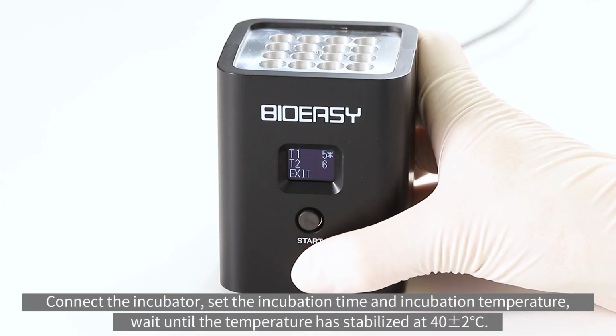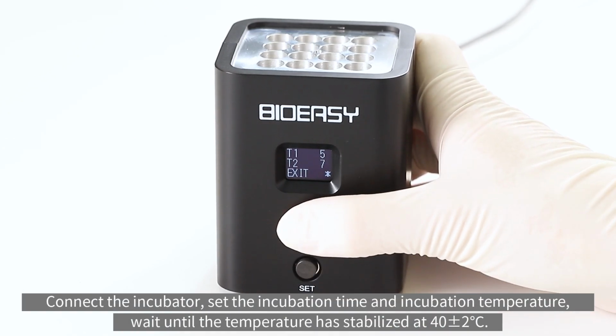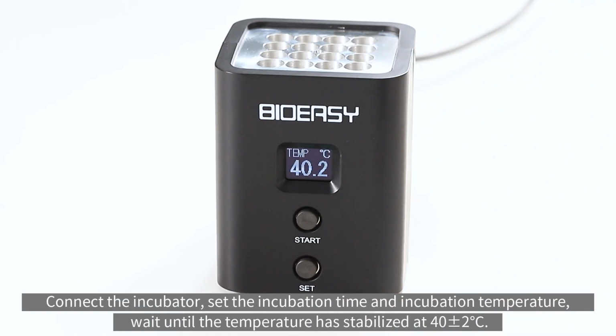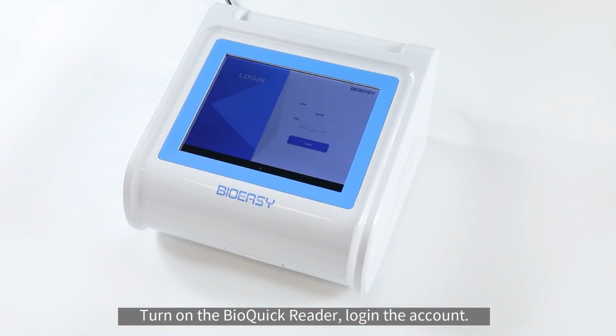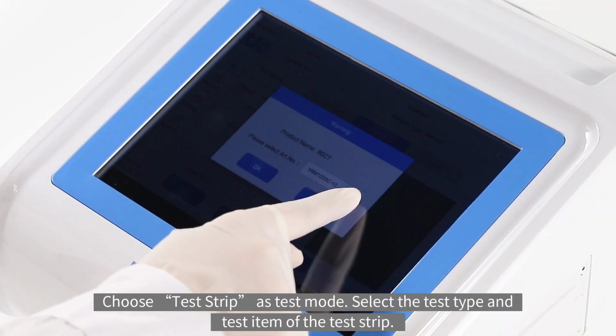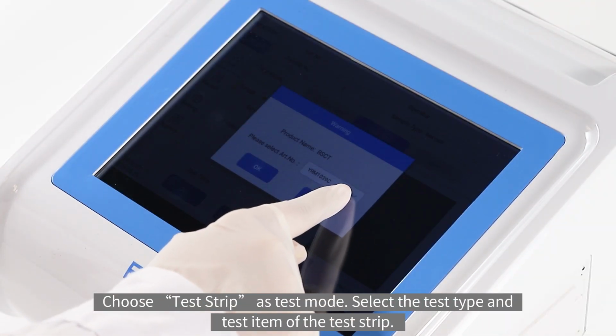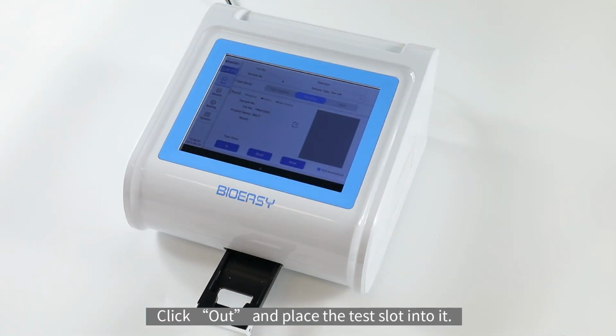Connect the incubator, set the incubation time and incubation temperature, and wait until the temperature has stabilized at 40 ± 2 Celsius. Turn on the BioQuick reader and log in the account. Choose Test Strip as test mode. Select the test type and test item of the test strip. Click out and place the test slot into it.